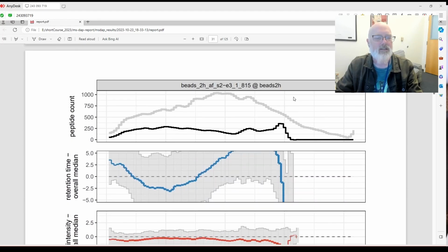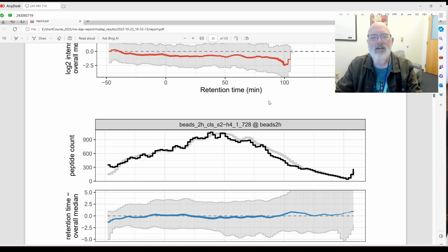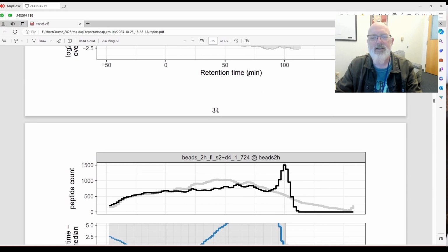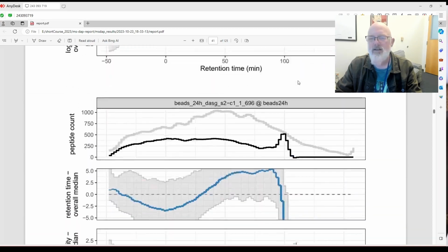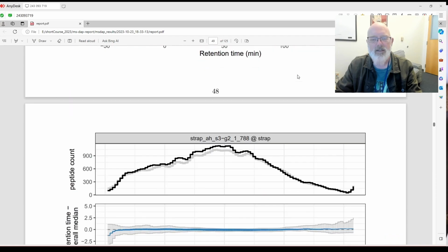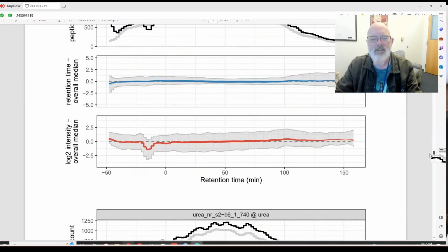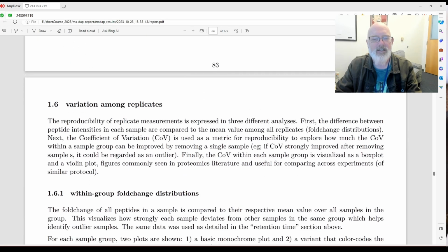Okay. Let's see. Peptide count, retention time over median. Okay, that's all interesting. We'll go look at that later. This is all retention time. Remember, at least for Spectronaut, this is not correct. This is not retention time in minutes. These are IRTs, so relative retention time. Okay, so maybe they could fix this in the next version of MS-DAP if you're using Spectronaut. Let's skip all this stuff. Okay, let's skip this. This is all very cool, but let's skip it. Okay, it looks like there's one of these for every sample. You can look at this to see if the column clogged or something with the retention time got messed up. All right.